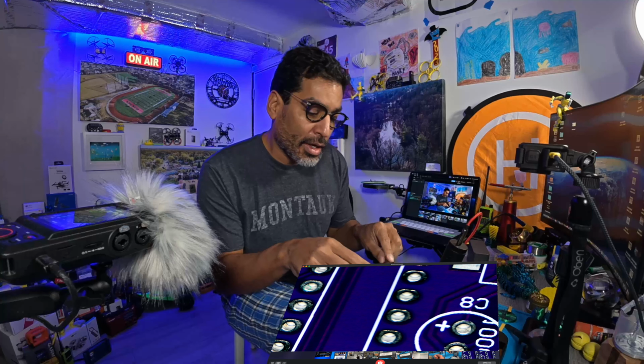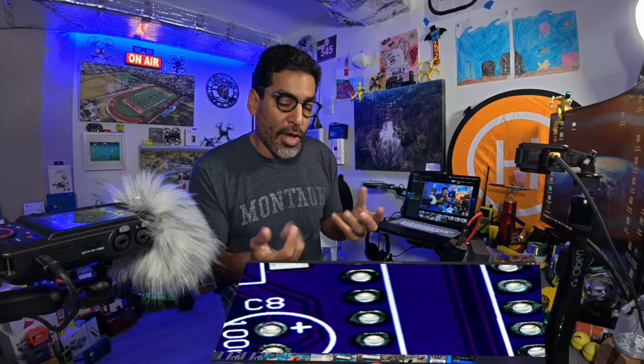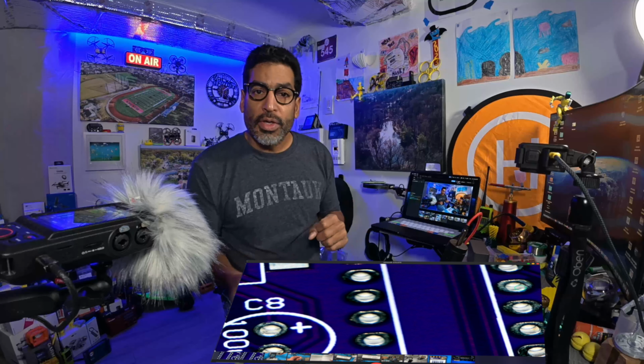In this video we're going to show you how to flip everything around so it doesn't look like this, but it looks like this. Or maybe you want to connect a microscope to your Apple computer and you can't, or you can, but it looks like this. As you can see, everything's just simply in reverse, but you want it to look like this. Alright, so without any further ado, let's get started.